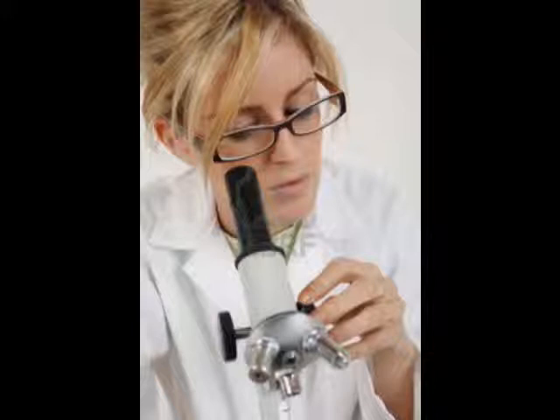What I do, I pour it in the top of the splitter and it splits it into two roughly equal parts randomly. And this randomizes the sample so that you get a representative small sample that you know is representative of the larger sample. And this just makes sure that what we're getting is going to be common throughout your entire sand.